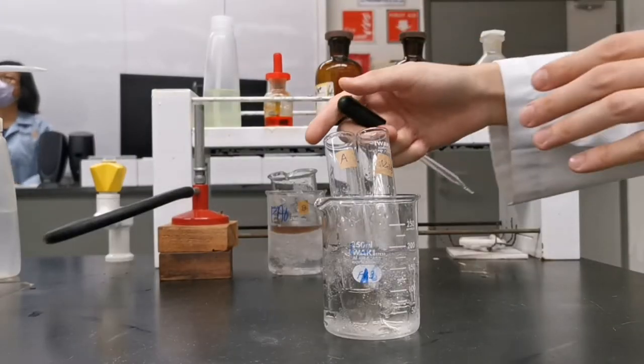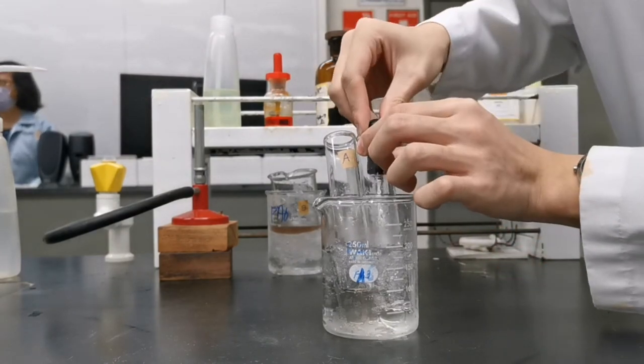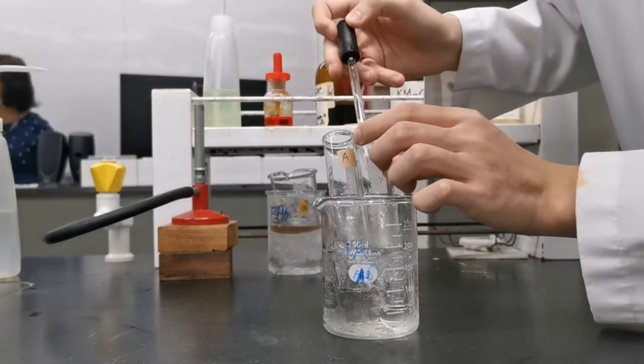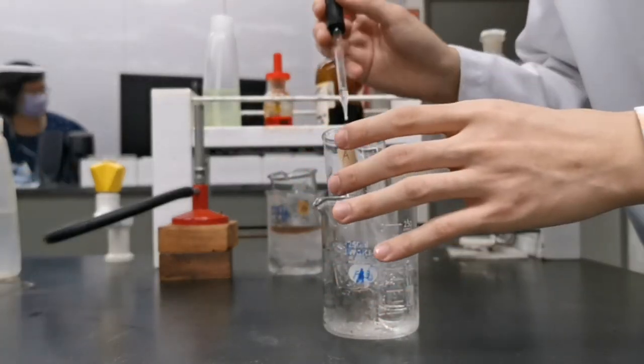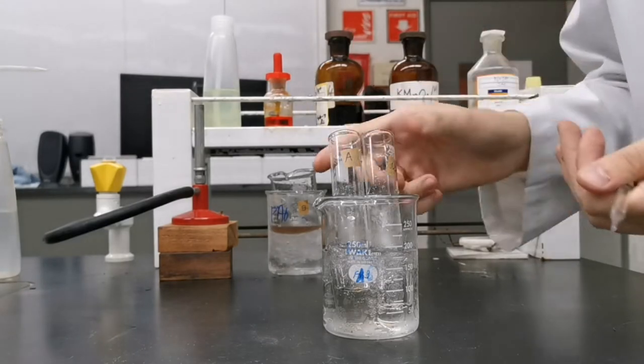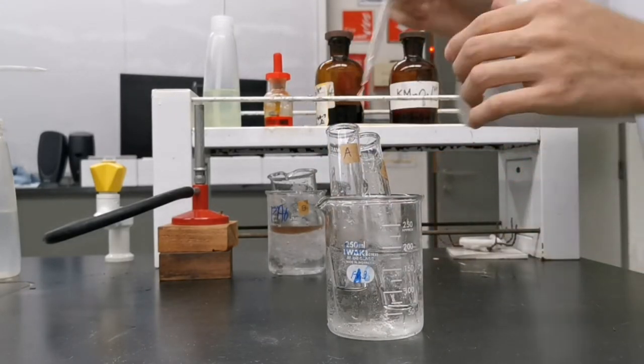Returning to my first ice bath, I carefully transfer all the sodium nitrite solution into the ethyl-4-amino benzoate mixture drop wise using a teat pipette. At this point a diazonium ion is formed.